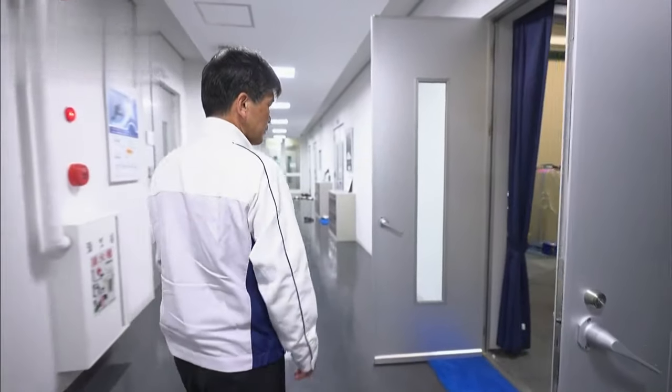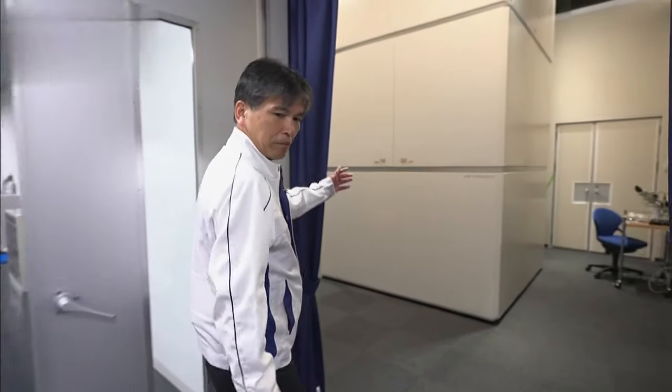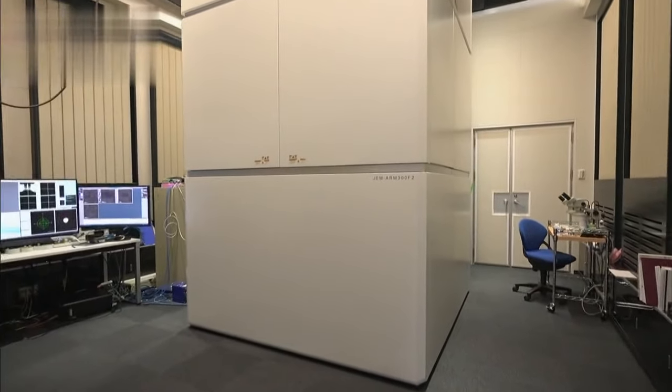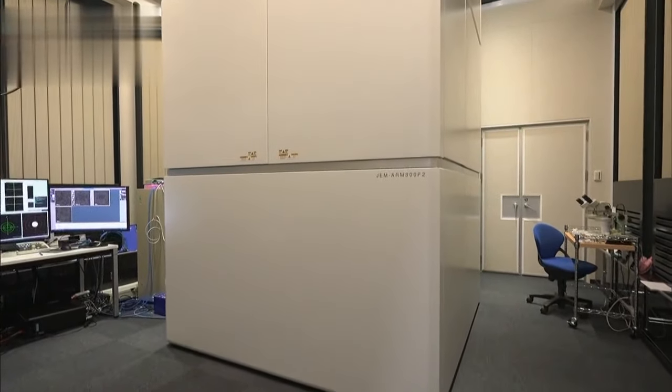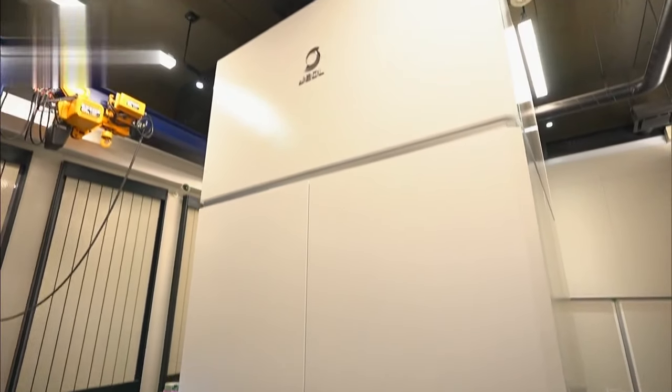This company even has a large device capable of viewing the tiniest particles which compose matter — atoms.